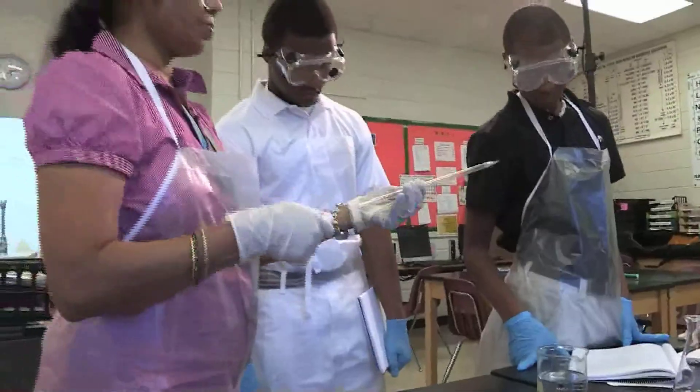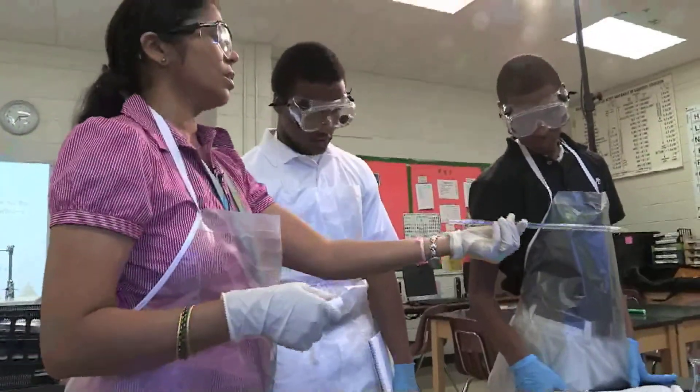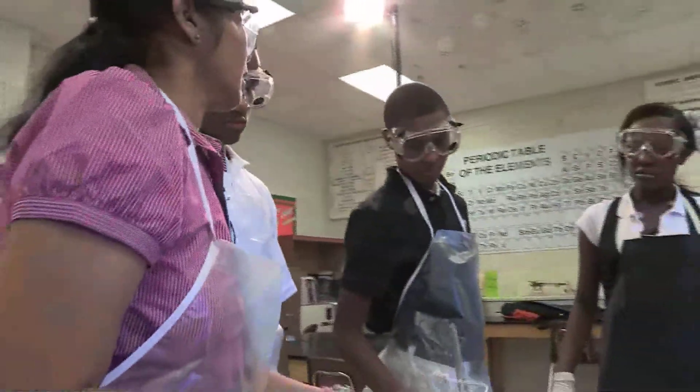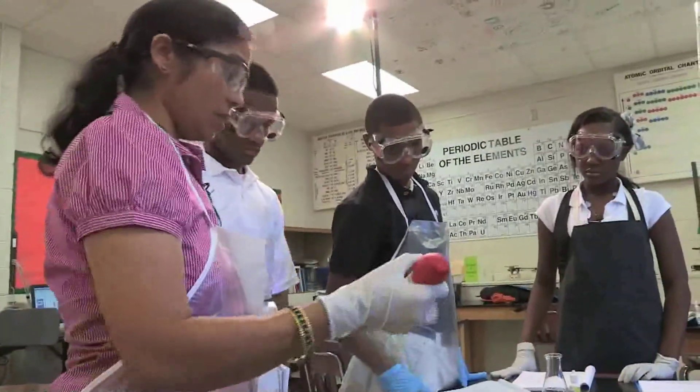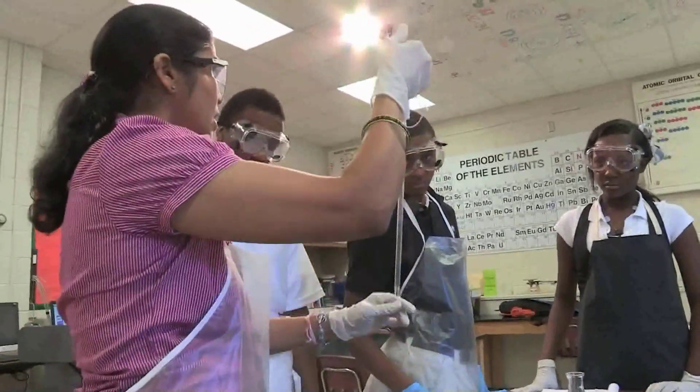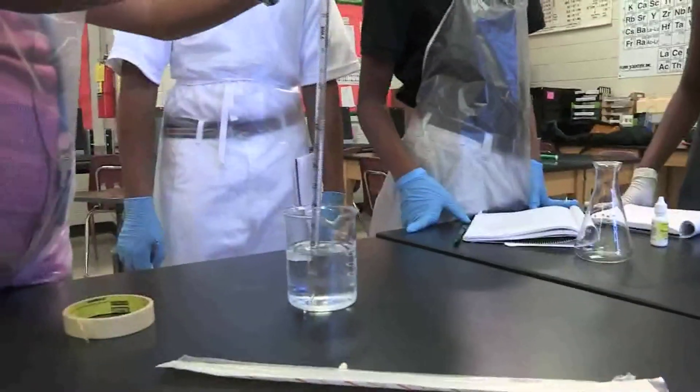How much volume can you get from this pipette? You can all get 10 milliliters. So how to use pipetting is a technique that you have to know. You have to make sure you clear out the air — it has to suck that in — and then slowly, slowly. The better you are at math, pretty much the better you are at chemistry.